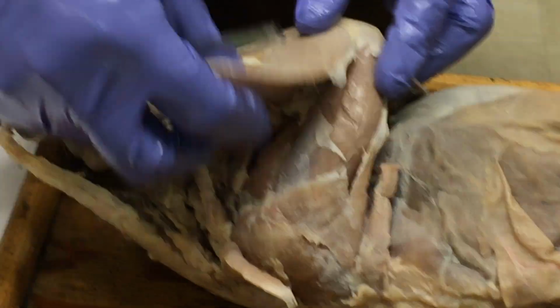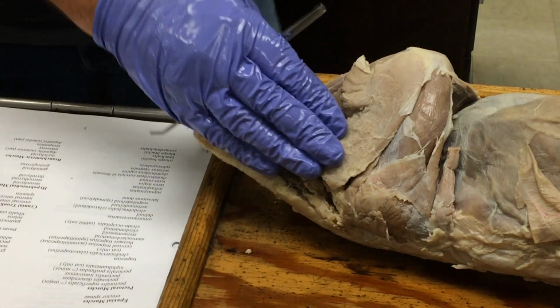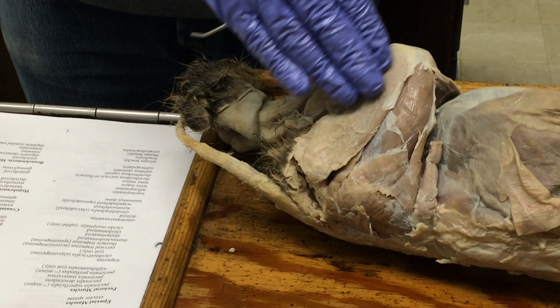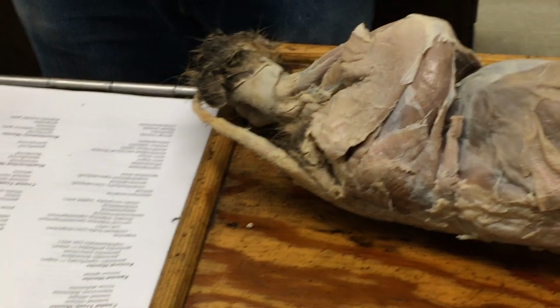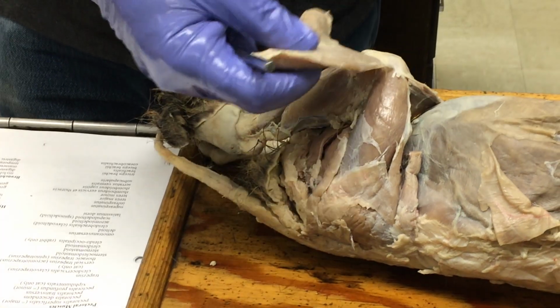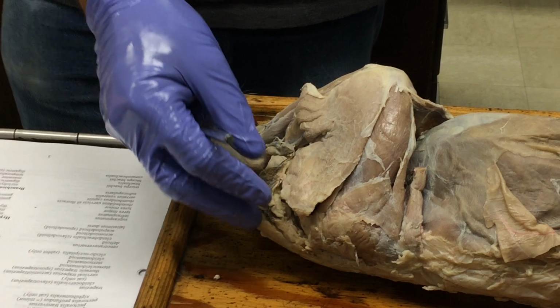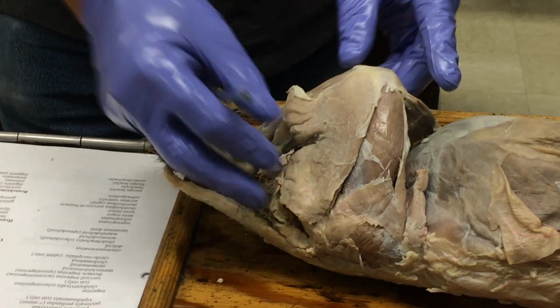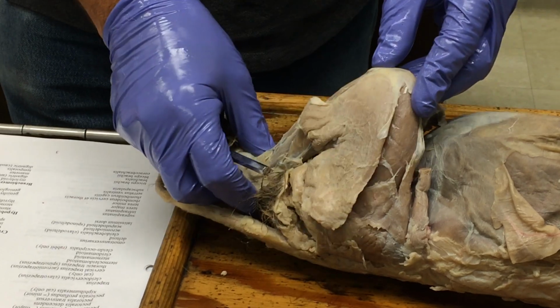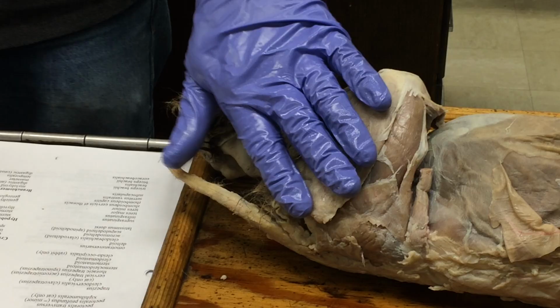Biceps femoris. This is one that you guys should like because it's big, it's obvious on the lateral side of the thigh. I just kind of put this all back together again, but it's this muscle right here, it's biceps femoris. I mentioned in people it has two heads. In our critters it's just got one. But this is part of the hamstrings group of muscles. It's a muscle that is really important as a retractor of the thigh and a flexor of the knee. Okay. That's biceps femoris in the cat.